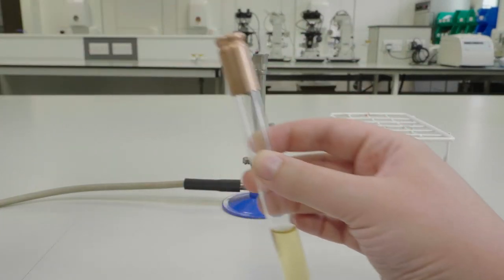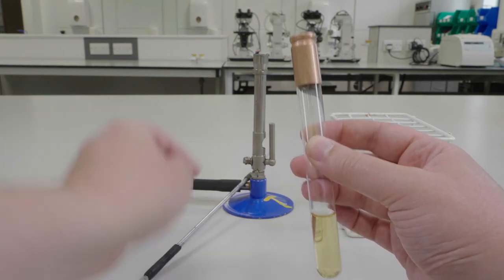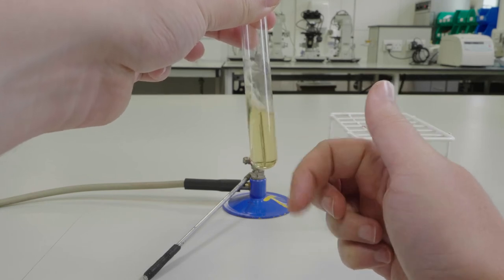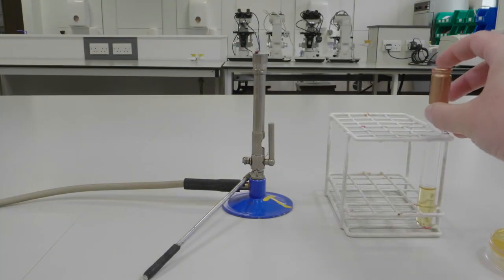This prevents you from aerosolizing the organism and as a consequence stops you from breathing in a potential pathogen. Once you have replaced the lid, you can gently agitate your culture to ensure your bacteria have dispersed within the culture medium.